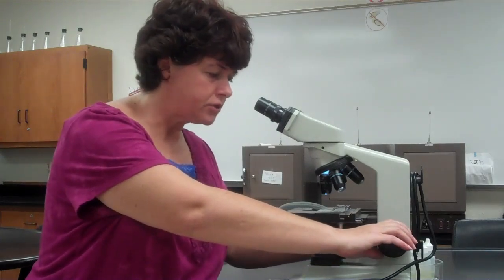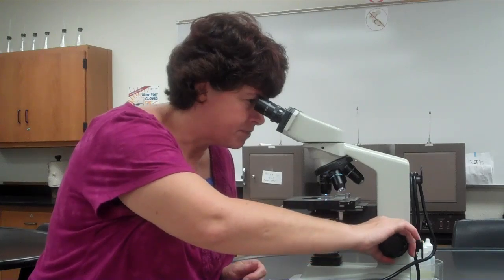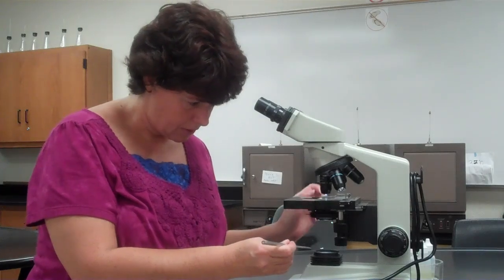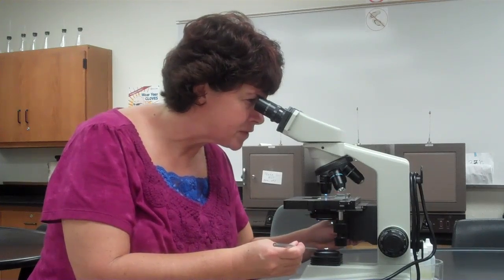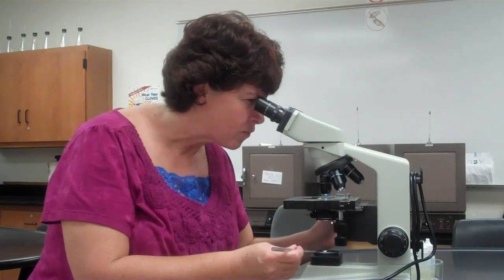Now, to see if your condenser is in the right place, I have a little trick. So what you do is you find your specimen by using the coarse adjustment knob with the 10 power. So I kind of found it there. Now, to see if your condenser is the right place, take your loop, hold your loop over the light source, looking through the microscope, try to focus on the loop. It'll be a little bit blurry. So what you can do is you move the condenser until your loop comes into focus. Your specimen will go out of focus. Once that's done, that's exactly the perfect place for your condenser.